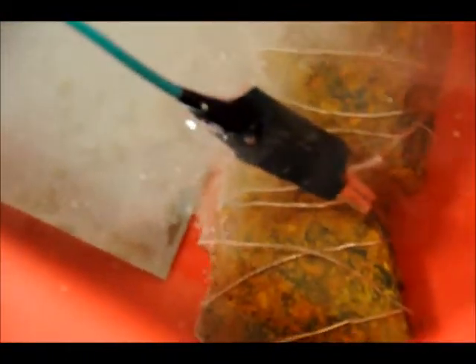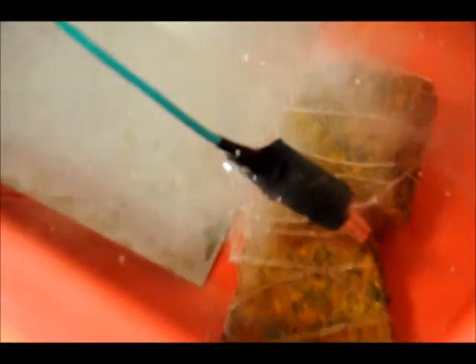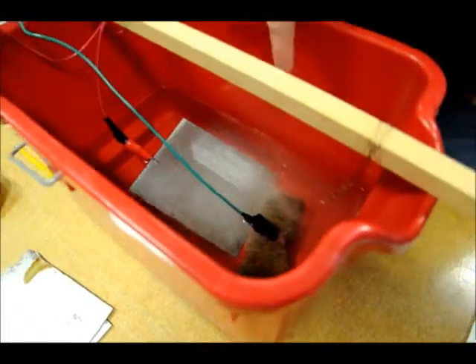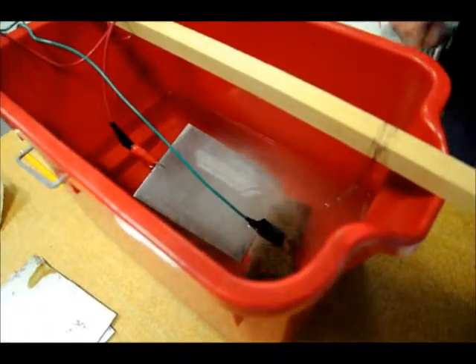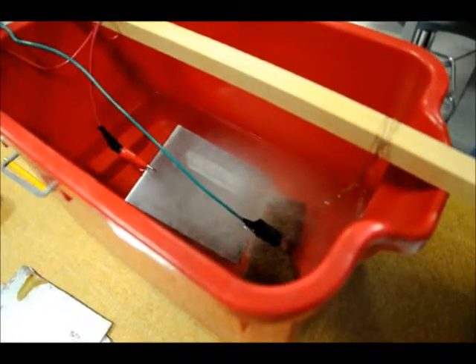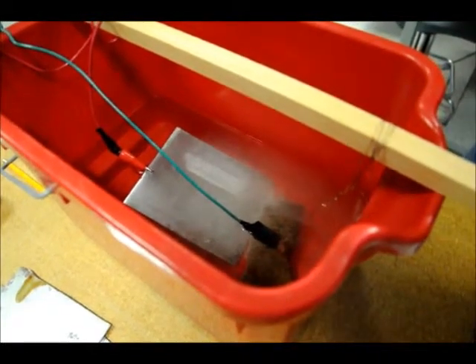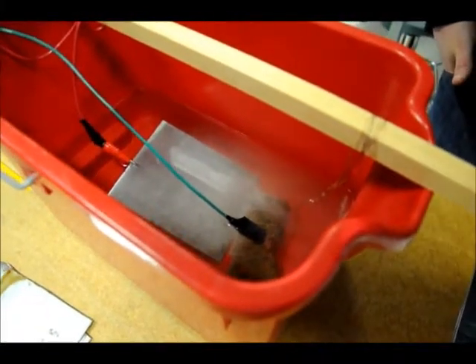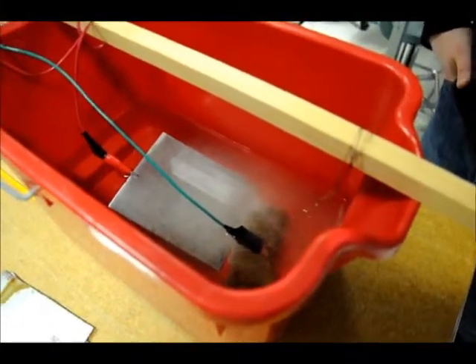Stainless steel plate, sodium hydroxide, copper wire, ferrous based object — hydrogen gas being produced at the cathodic site of the artifact. And that's it. It's like magic, really.